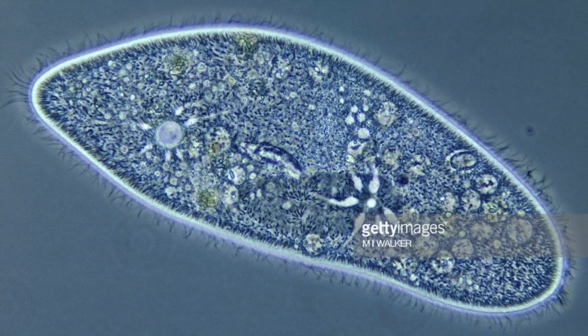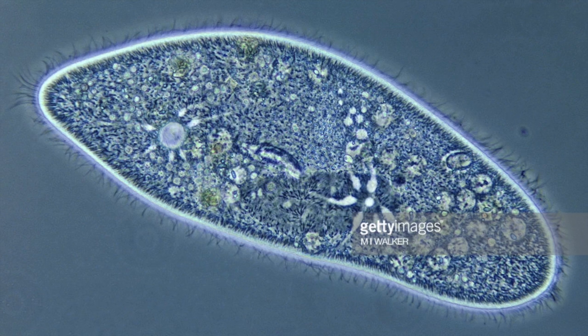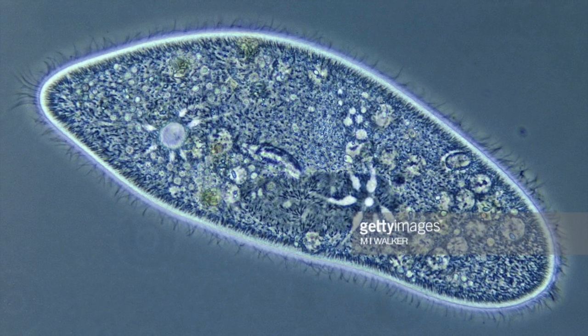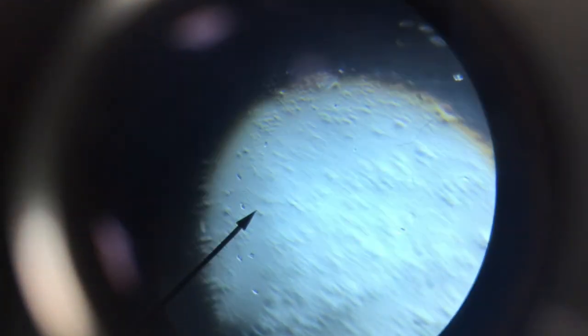Paramecium reproduce sexually under stressful conditions. This is also known as conjugation, when two paramecium fuse temporarily and exchange genetic material.